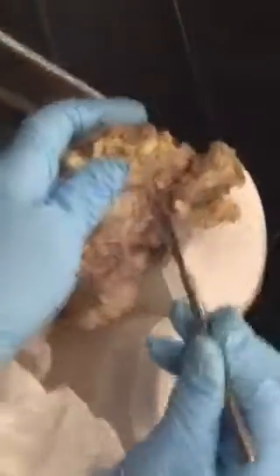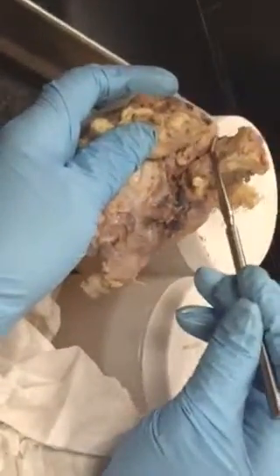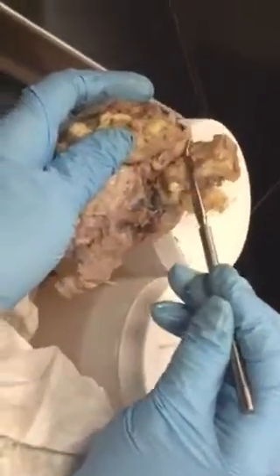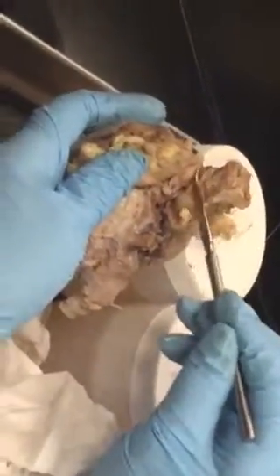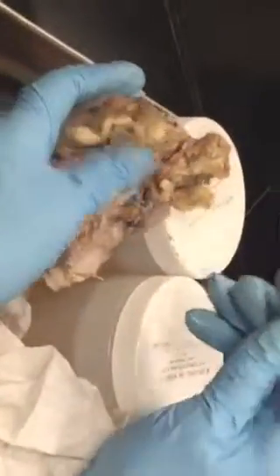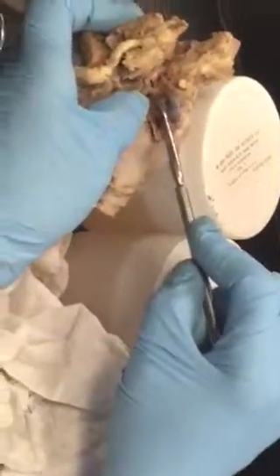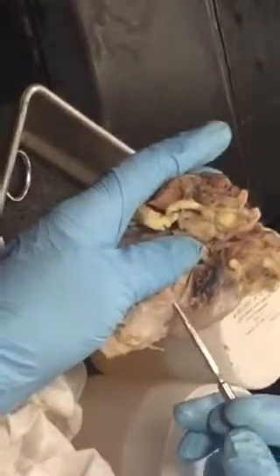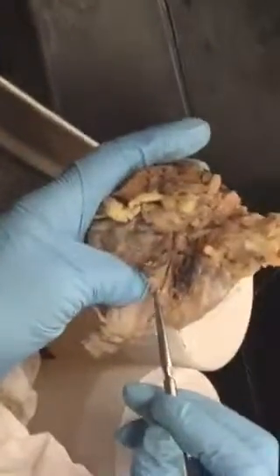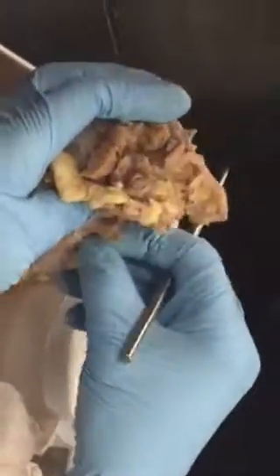This is optic chiasma. There you would have the optic foramen of the sphenoid bone. In the anterior part, the floor of the frontal bone, you have two small notches, but I won't test you on that. Okay. And so you have seen olfactory bulb, optic nerve, optic chiasma, oculomotor nerve. If I'm careful, there should be the sixth cranial nerve. I believe that's also visible somewhere in this region. If I peel it off, let me see.